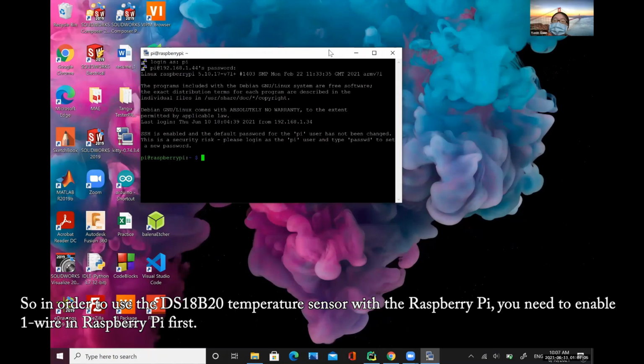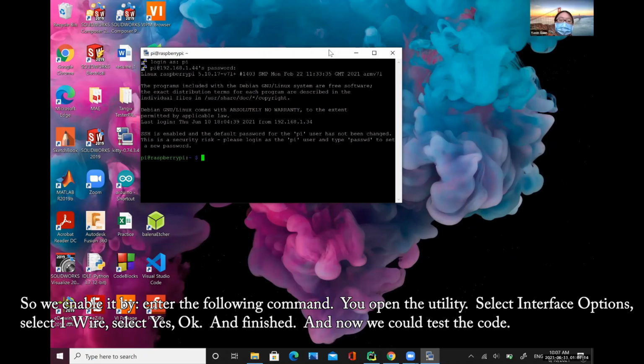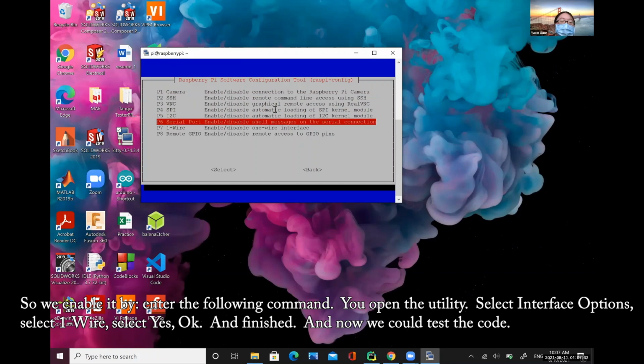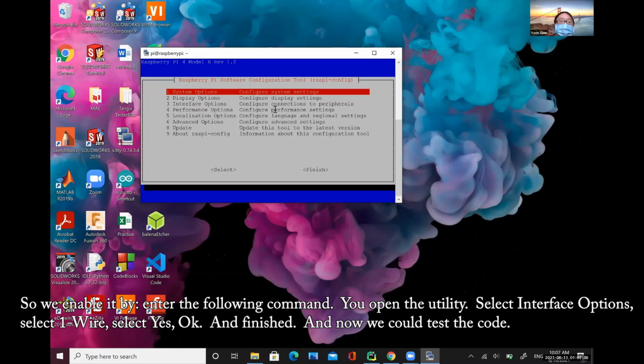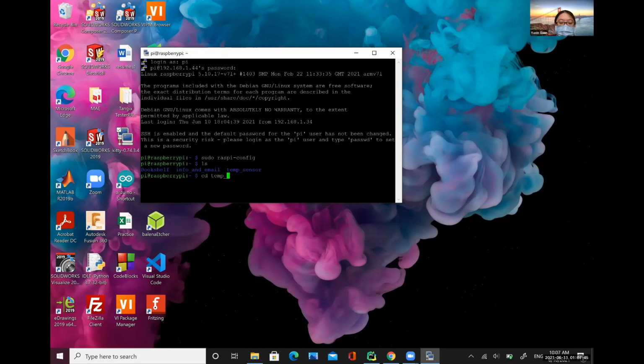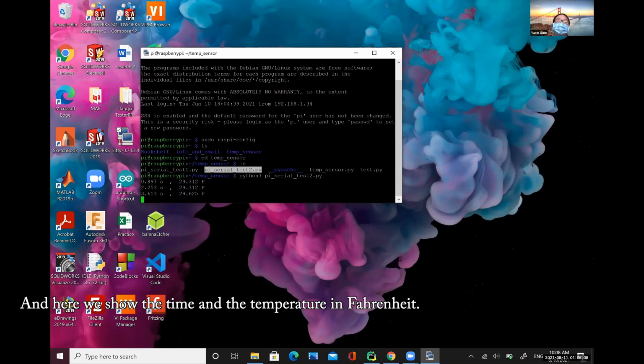So in order to use the DS18B20 temperature sensor with the Raspberry Pi, we need to enable one wire in the Raspberry Pi first. So we enable it by entering the following command to open the utility, select interface option, select one wire, select yes, okay, and finish. And now we could test the code. And here we'll show the time and the temperature in Fahrenheit.